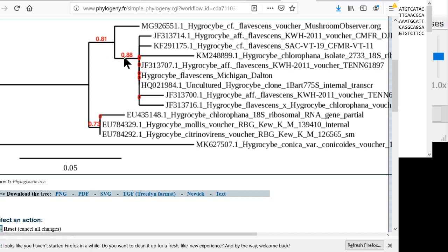Bootstrap support is calculating how likely it is that it got the branch in the right place. Bootstrap support over 0.7 is generally thought of as pretty good, so this one just barely makes it. If it's under 0.7, then the computer is really just guessing where to put the branches, and reality could be much different. So you definitely want higher numbers here. One way to get higher numbers is to sequence more genes, and by sequencing more genes, you can have more confidence that these things are all going in the right spot in the tree. But this bootstrap support's not bad here, so this tree is probably correct.